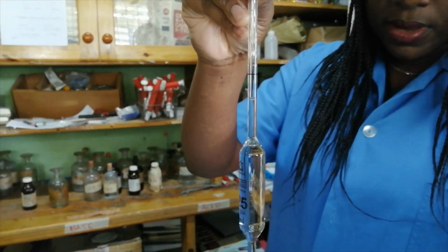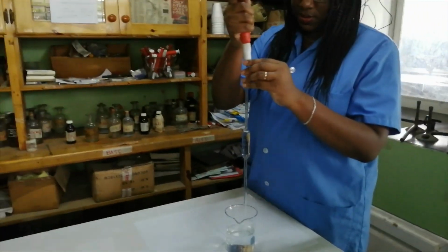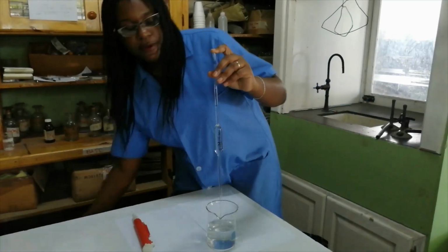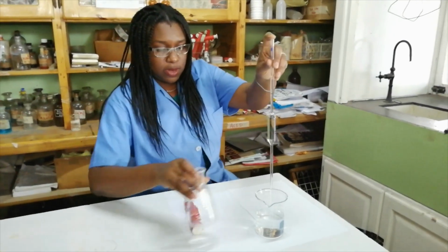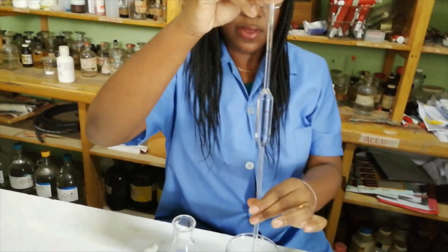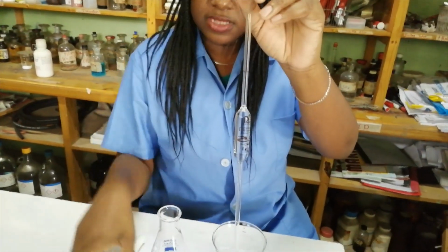All right. And I'm going to refill so that the meniscus is resting on that line. At this point, we're going to sit down because we're not on punishment when we're doing our practical activities, no. Oops, I wasn't paying attention. Don't let this be you.